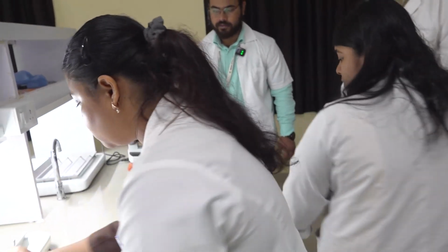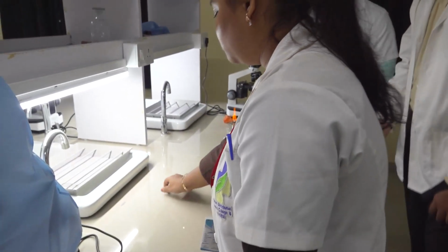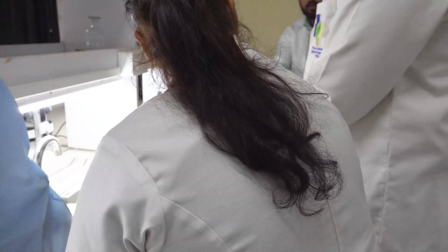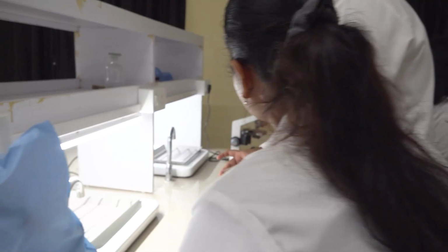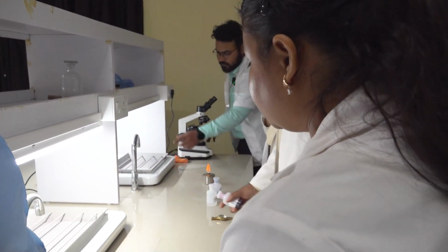Books हटा लो, क्योंकि इसमें पानी वानी गिरेगा तो problem हो जाएगा. तेरा वाला कर दूं, help चाहिए? कर लेगा. ठीक है, ठीक है. Do it here. Do this one.